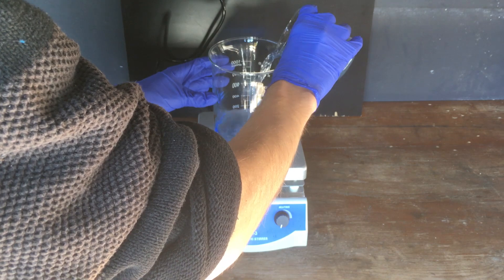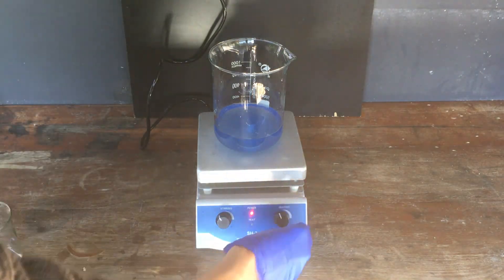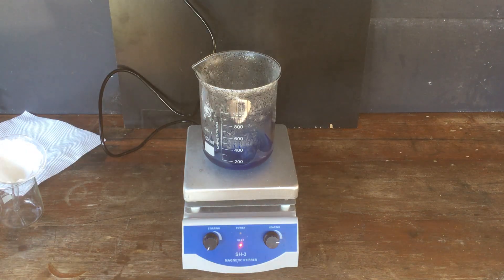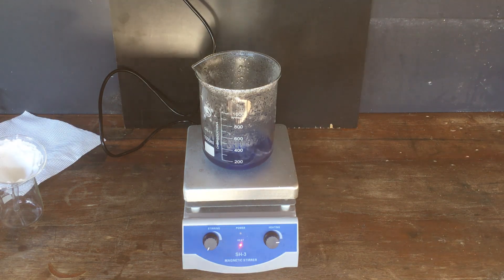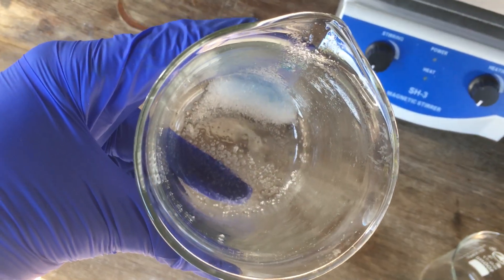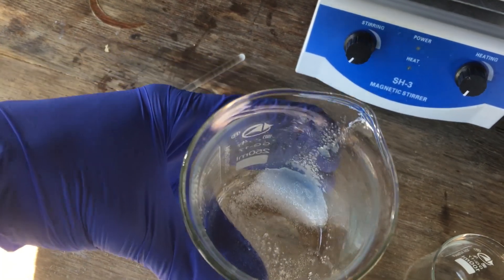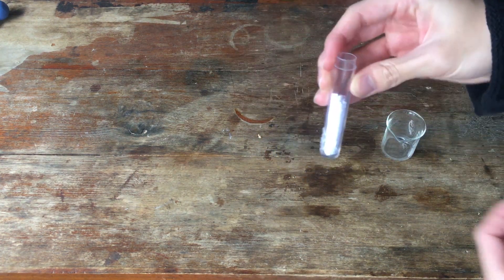Our first step with the anode solution is to boil it down so that it's easier to work with. In the middle of boiling it down, I realize I've made a pretty big error with this synthesis — that is the fact that I've done this on a really large scale. I have 400 milliliters of solution here, and in solution I have approximately 40 grams of potassium hydroxide. Since I'm expecting only around 1 gram or so of potassium nitrate, it's going to be really hard to separate this out from the rest of the anode liquor. All we end up getting is potassium carbonate, which has appeared due to carbon dioxide in the air reacting with potassium hydroxide in solution. So I accept that I can't separate out any potassium nitrate product, and we move on.